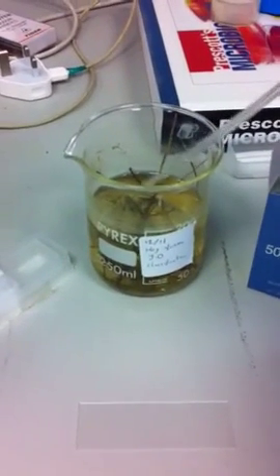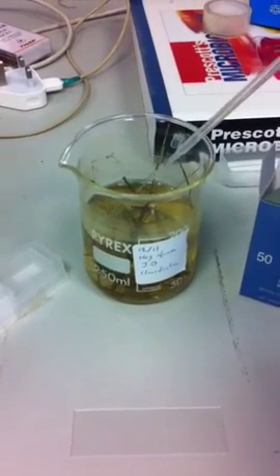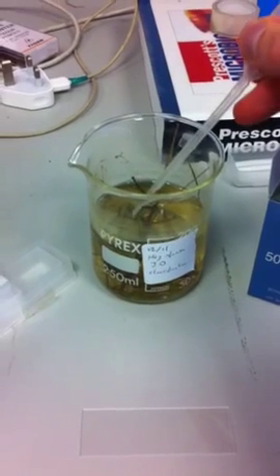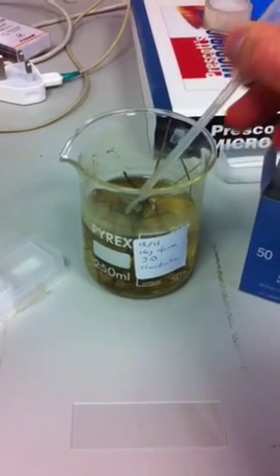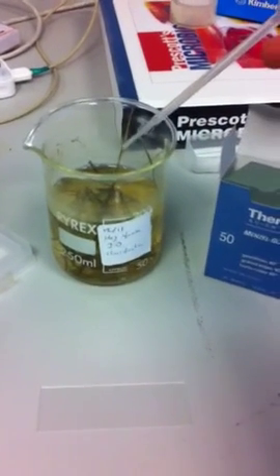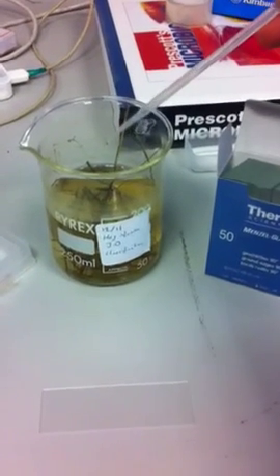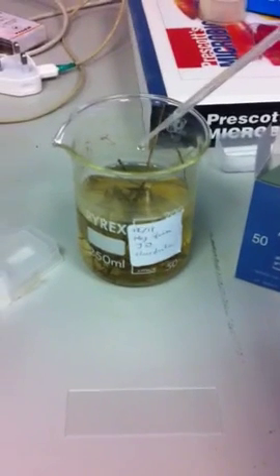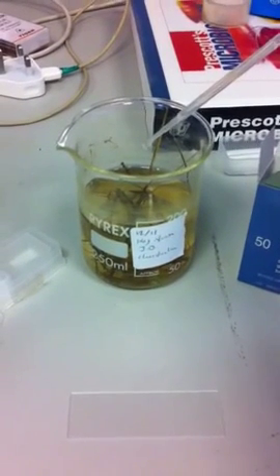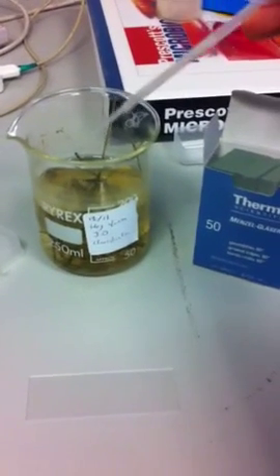Ok, so we'll use a pipette. Get a little sample from the bottom here. Then what we're going to do is make sure we've got it to the end. Ok, we put a single drop onto the slide in the center.